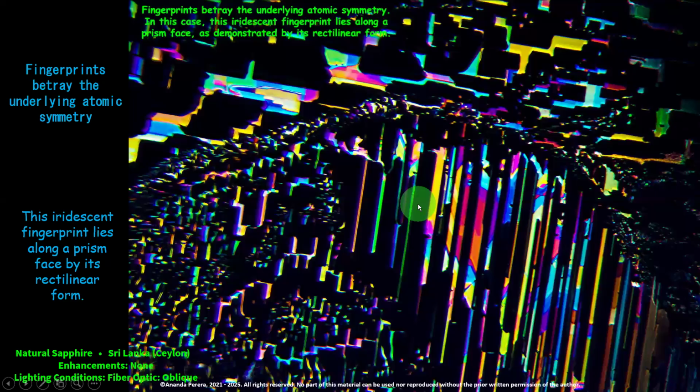We are moving to the next. Very beautiful, very beautiful fingerprint is here. What is the lighting condition? It is fiber optic oblique. You can see the rectangular shape of these. All are rectangular shapes.